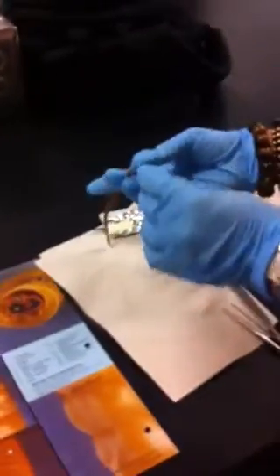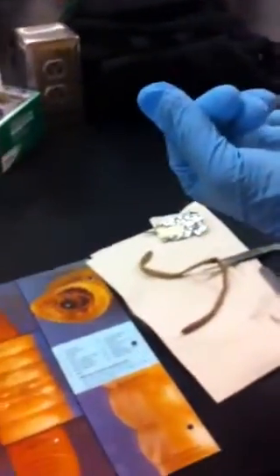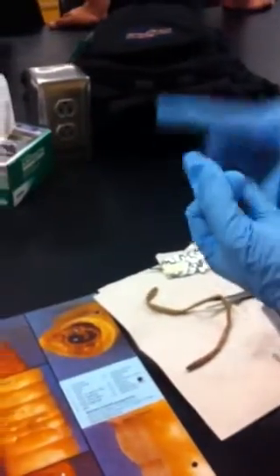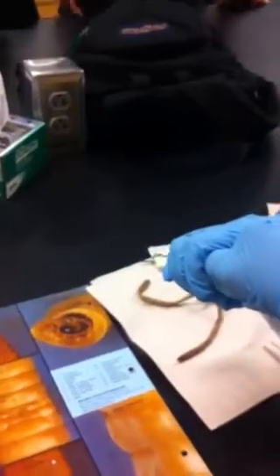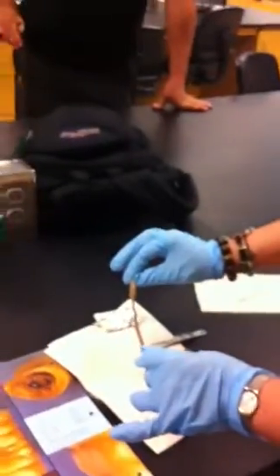But again, right, that's the part that you can tell that's where the ovaries are. So now you not only have a digestive system, right, full-blown digestive system, you have a full-blown respiratory system, you have a full-blown circulatory system, you have a full-blown excretory system, and reproductive system. So the only thing really that this thing does not have, that a cat would have, right, is the skeletal system. It does have it, but it's called hydrostatic.